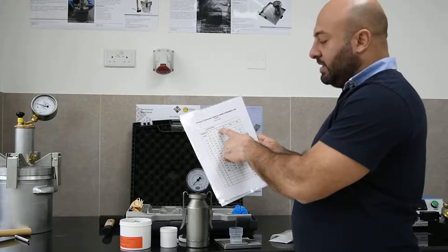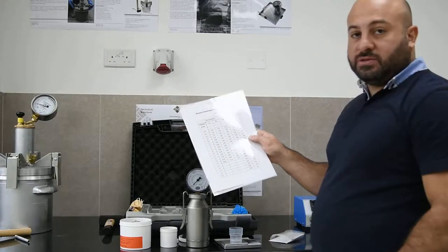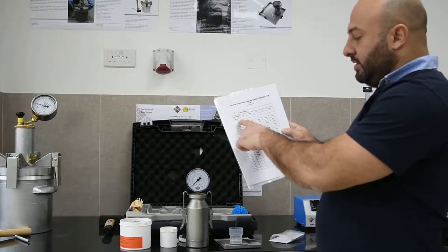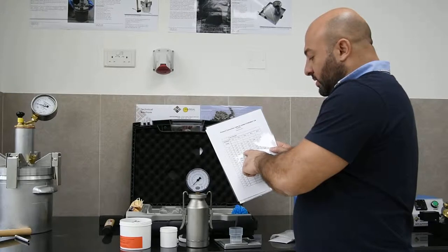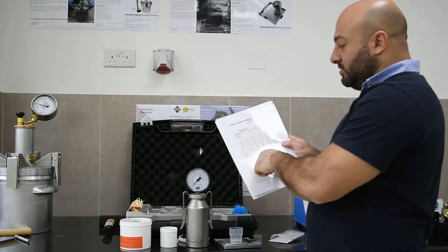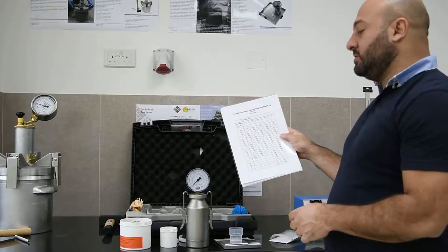So you can have 5, 10, 20, 50, and 100 gram soil, and each one of these will give you different reading and each one of them will give you the percentage of moisture in the soil.